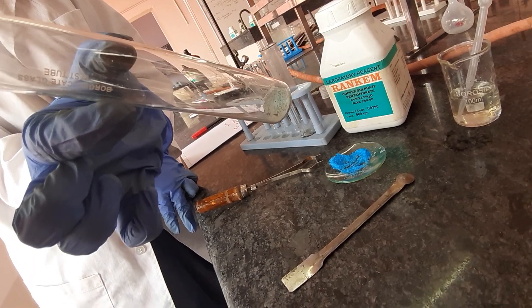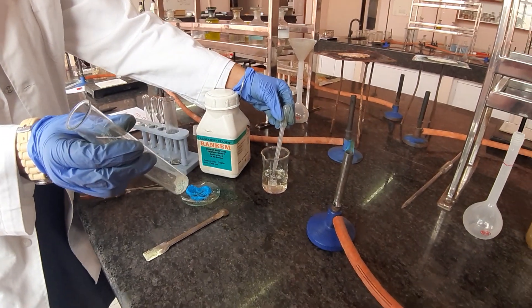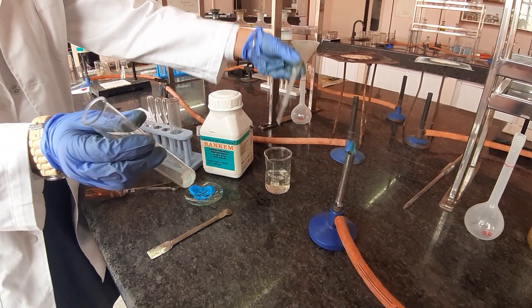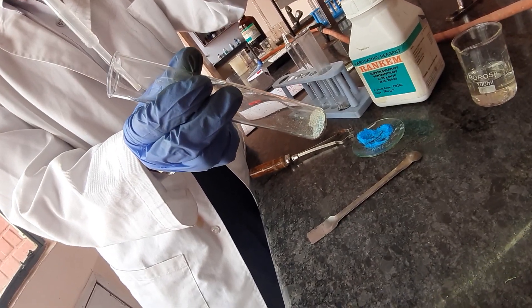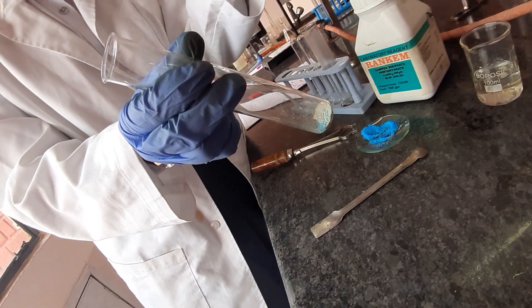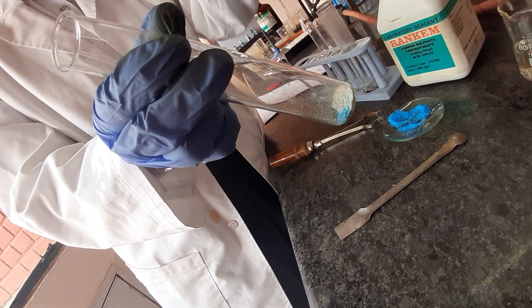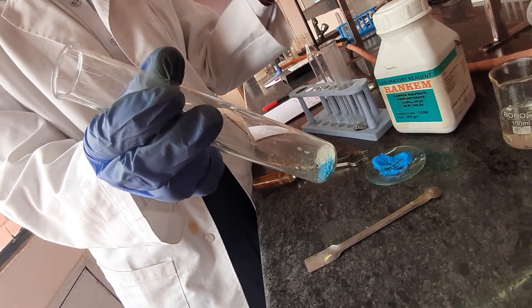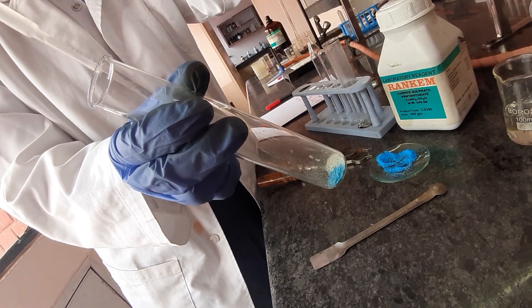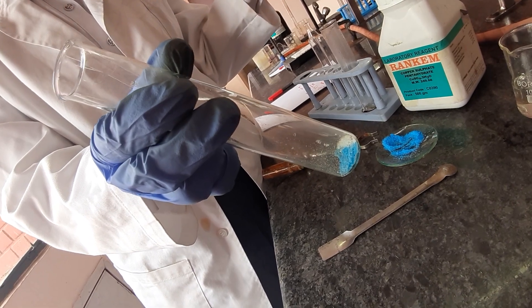Now we will try to add water to it through a dropper. She is taking water through the dropper and will add just a drop of water into these white crystals of copper sulfate. Can you see the transformation of blue color? Add another drop, and add to the other side of the tube. It is slowly changing back to blue as it gets wet.